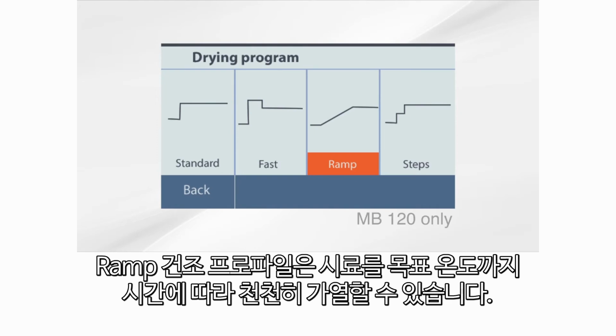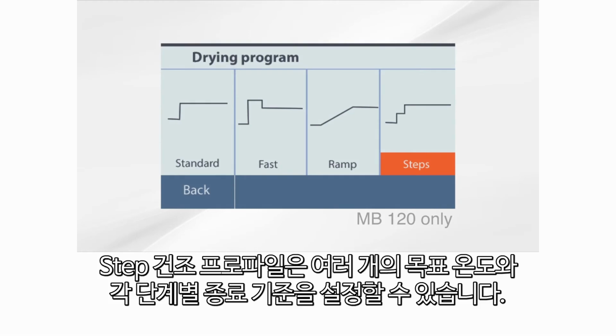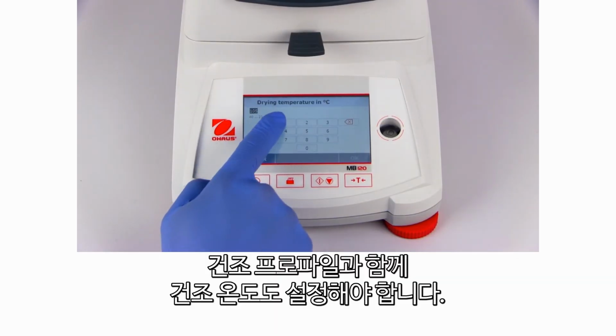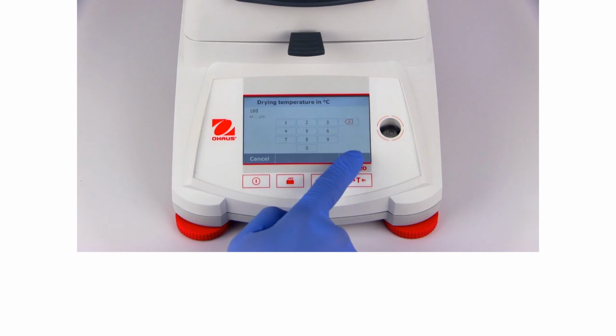The ramp drying profile lets you heat your sample to the target temperature shown slowly over time. The step drying profile lets you set multiple target temperatures and a shutoff criterion for each step. In addition to a drying profile, a drying temperature must be set.